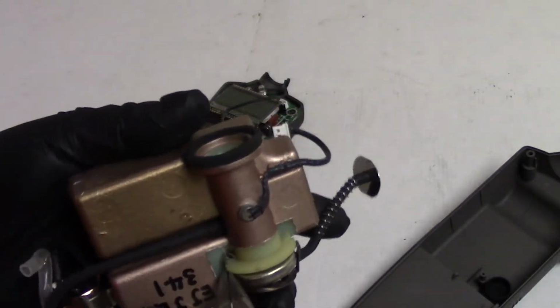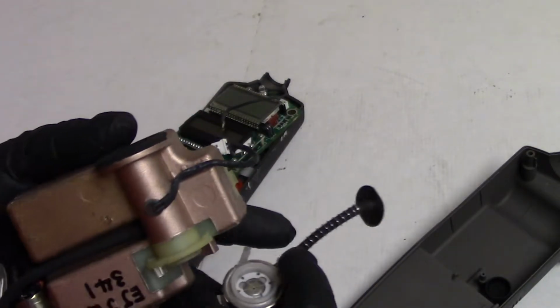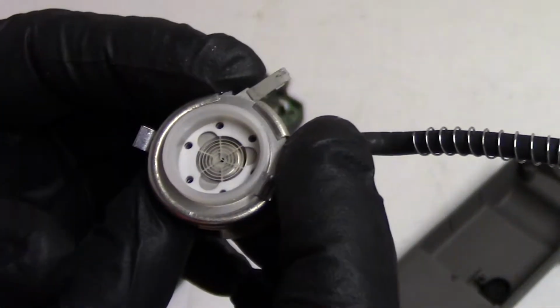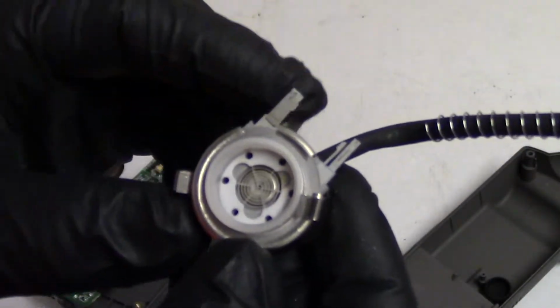Now, if I do wreck it, it's really not that big a deal. Like I said, I got it just for the sake of this video. Oh, but it looks like I don't have to wreck it. It looks like we can actually get a good view of the detection grid. So the air comes out through that hole in the center.